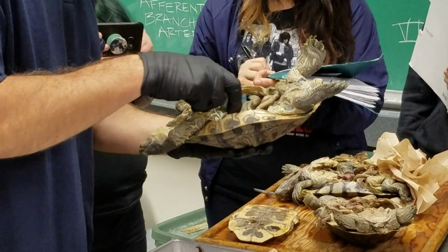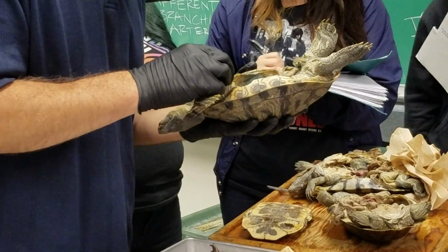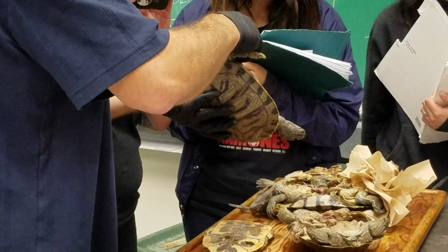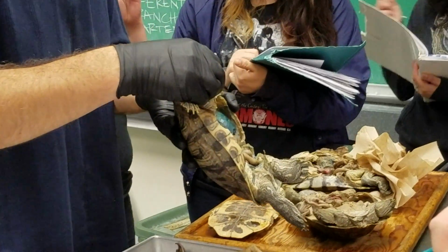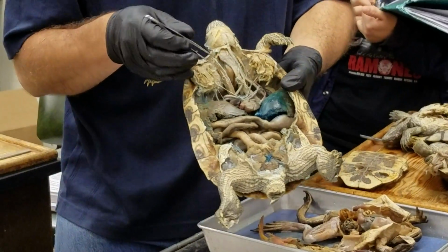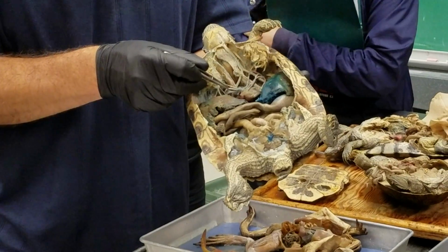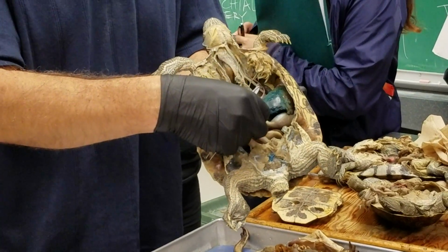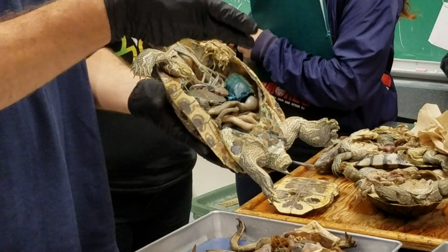And this guy here is nice because you can see a little bit better on it how that right systemic arch comes off and just curves around. Hopefully it's not too good, but you can see that one kind of curving around. And I don't want to pull his guts out and lift everything up like I did in the frog, but if I did, you would see exactly the same thing that we saw in the frog, where the right systemic arch joins with the left systemic arch back there behind the guts to make a single midline dorsal aorta, just like the radices do in the salamander.